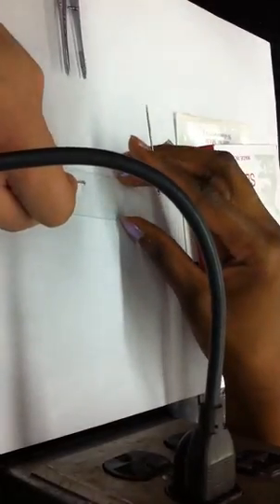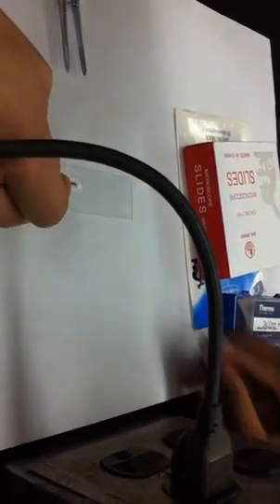Because see, you're getting gut contents there. So try and get that mixed with that saline. Can I just put this whole guy in? Yeah, yeah, yeah. Oh, okay. Once you've squished it, you can do that.